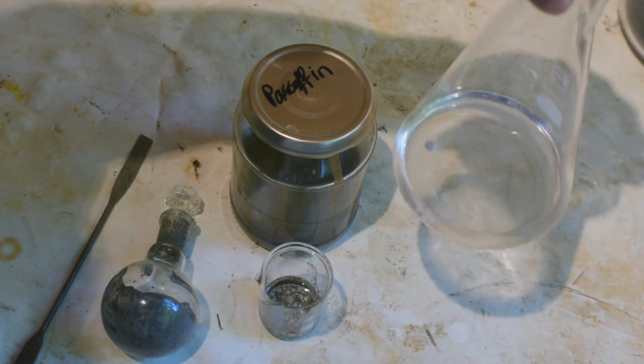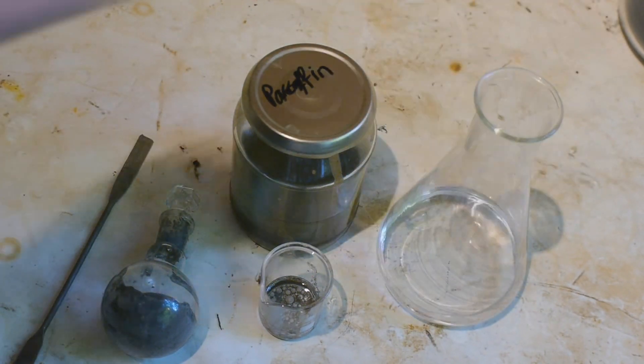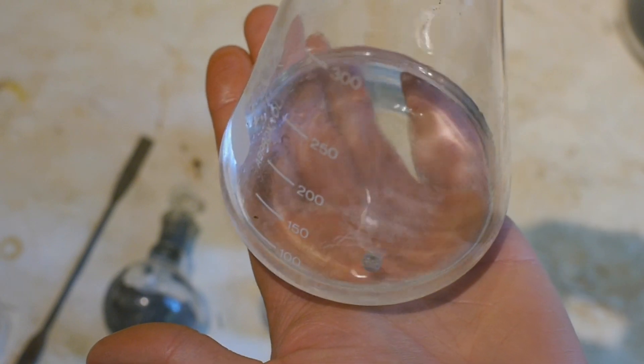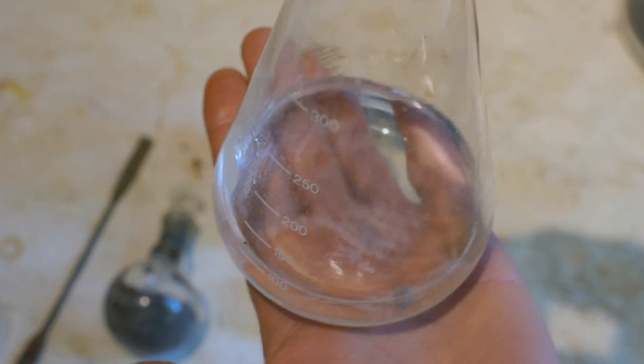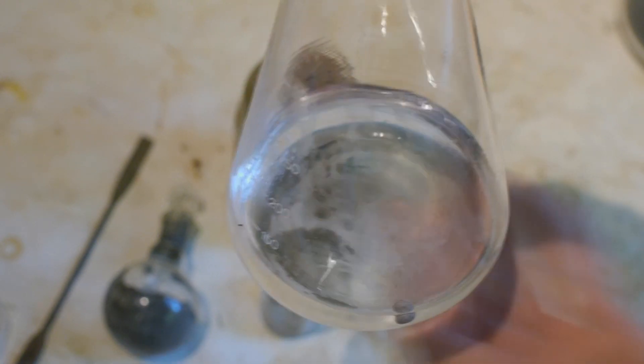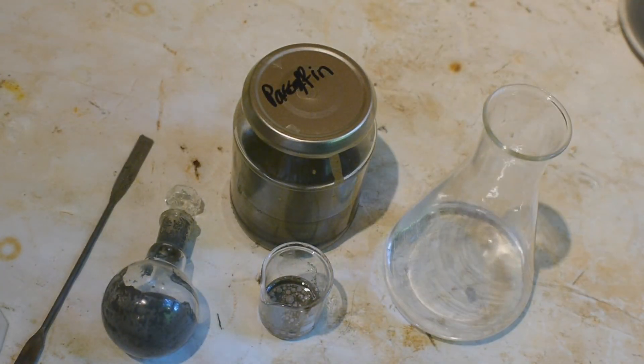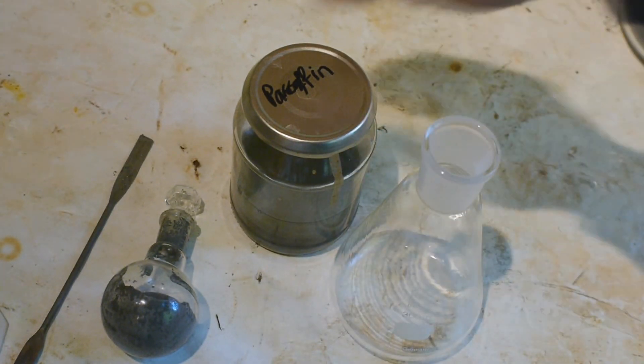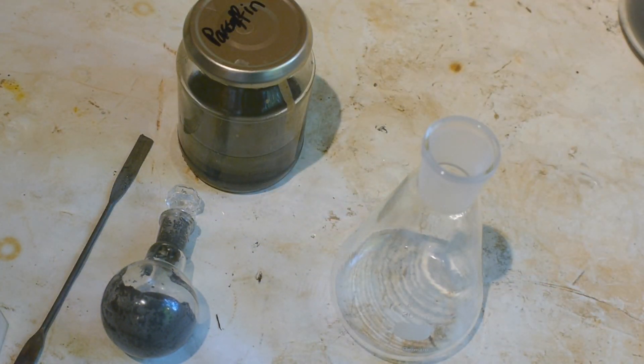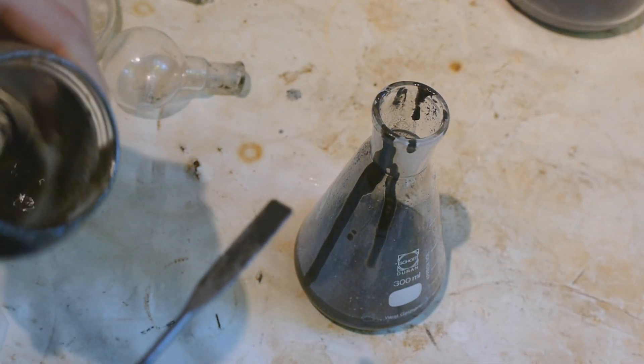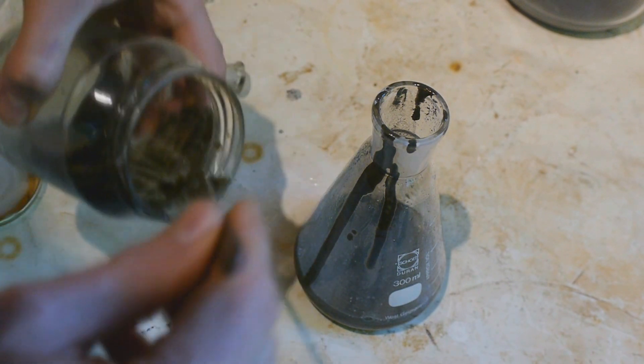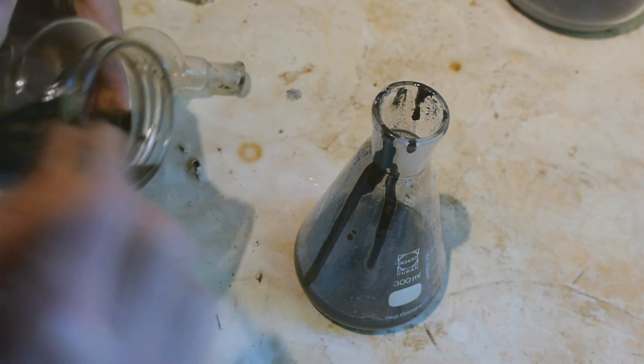Let's see if it survives. It swims. And is it bubbling? Can't see it from here. This is looking good. So yeah the sodium is swimming on the dioxane but there is no reaction taking place. So I can now take a fresh flask and transfer everything in there and then reflux it until we get some nice big pieces of sodium. Dioxane actually smells quite nice, but if you know it's the smell of death or cancer you don't like it so much. Stupid psychology, always ruins everything. Or maybe saves my life in this case.